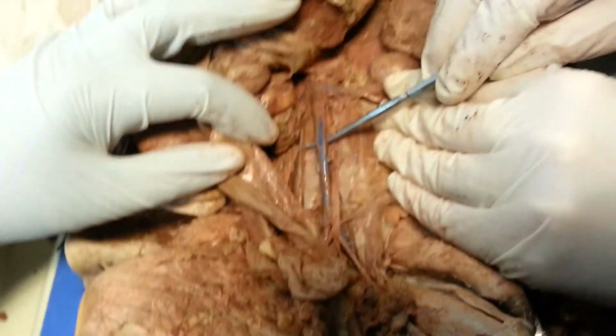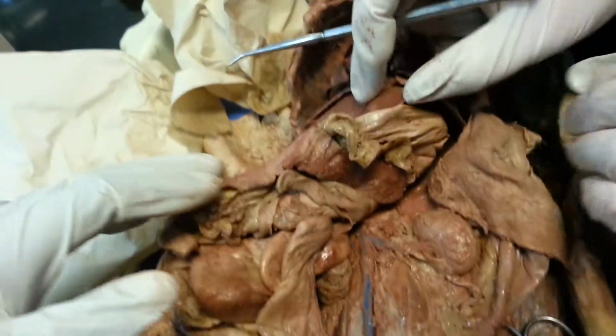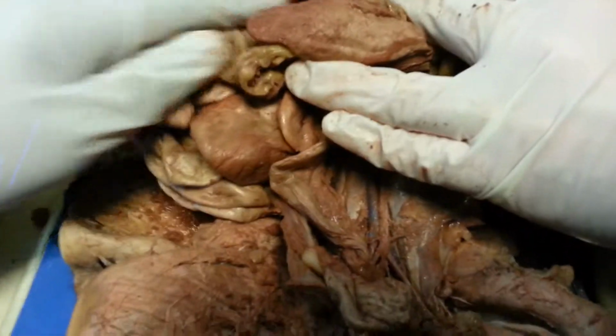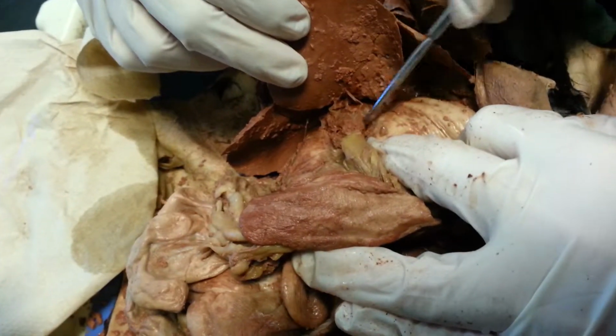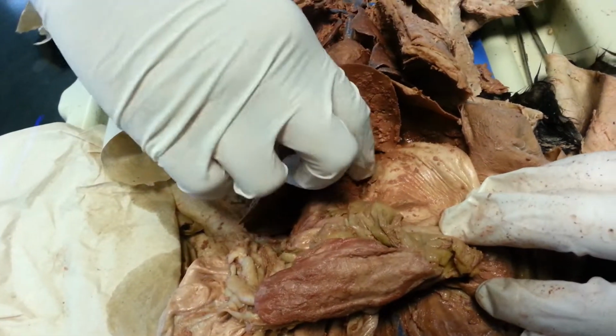Okay, all right. Once you remove some of this, you'll be able to see that as well. Right here you can see the inferior vena cava. Right here you can see one of the renal veins. Back up in here you should be able to find some of the hepatic veins. Are the hepatic veins going to branch off the inferior? They're going to feed into it. But you'd have to move stuff around a little bit in here to find that.